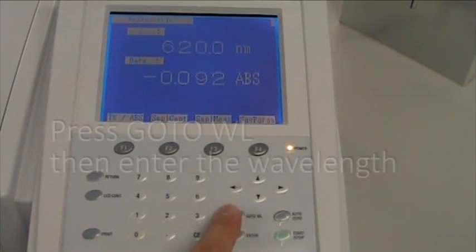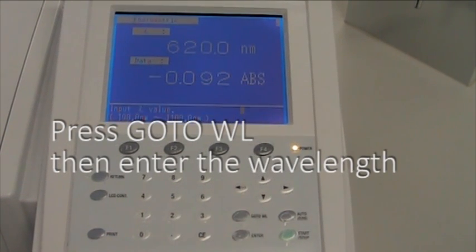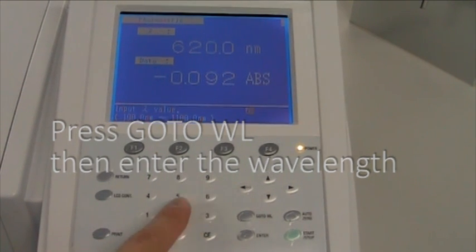Then, set the wavelength by pressing the go to WL button, entering the wavelength in nanometers, and pressing enter.